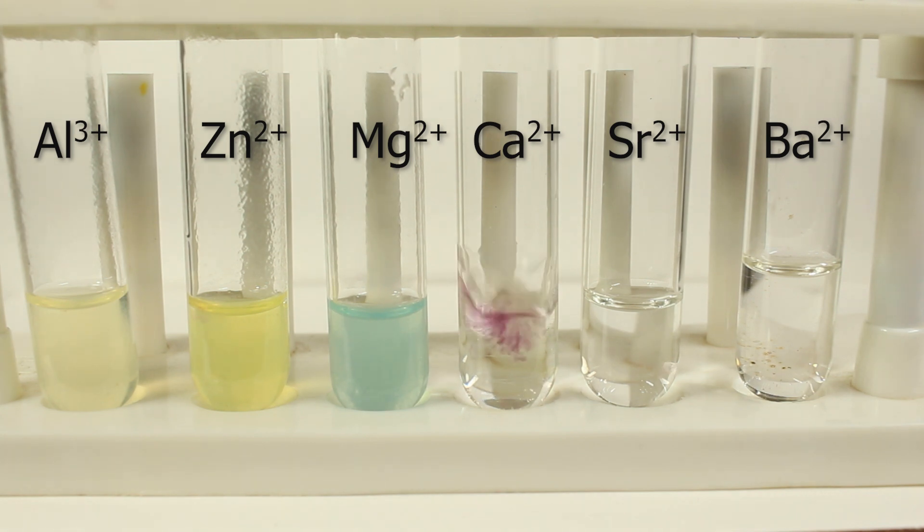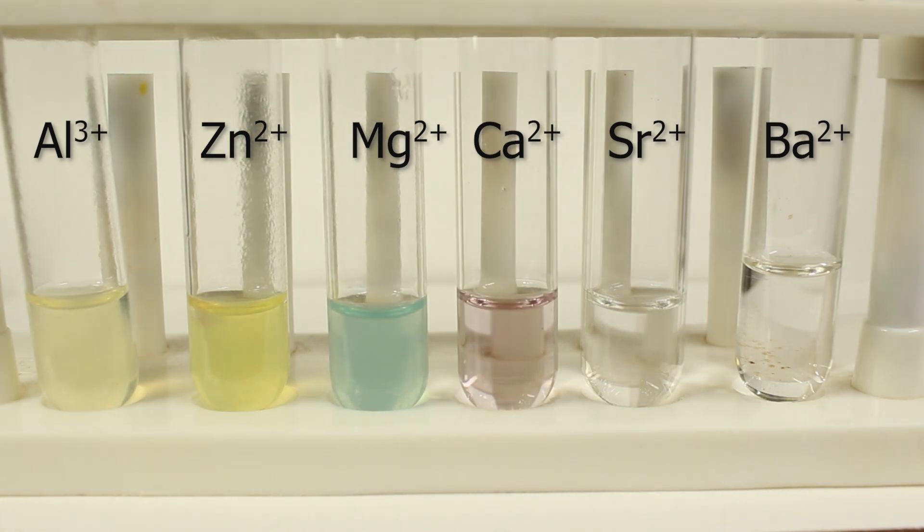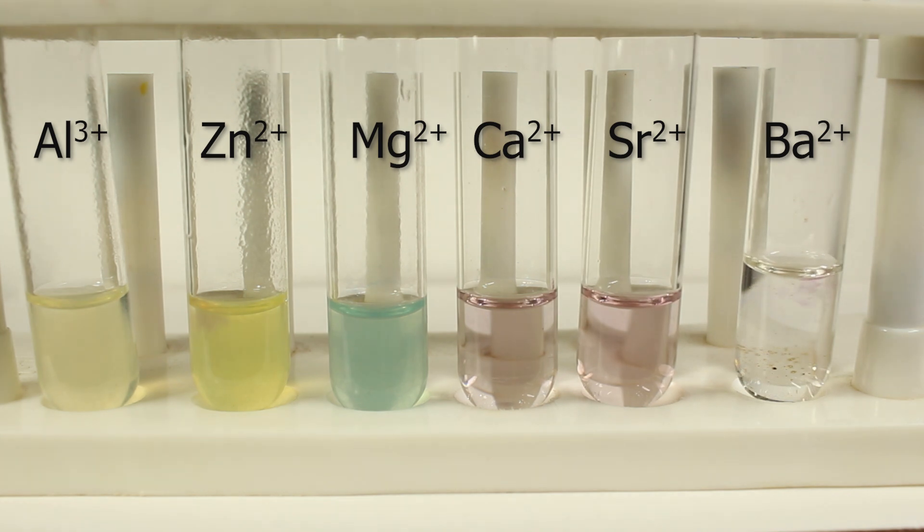What about calcium, strontium, barium? Concentration of this salt here is not high enough to precipitate the hydroxides. Naturally you'd expect precipitate of calcium hydroxide or strontium hydroxide. No, nothing.